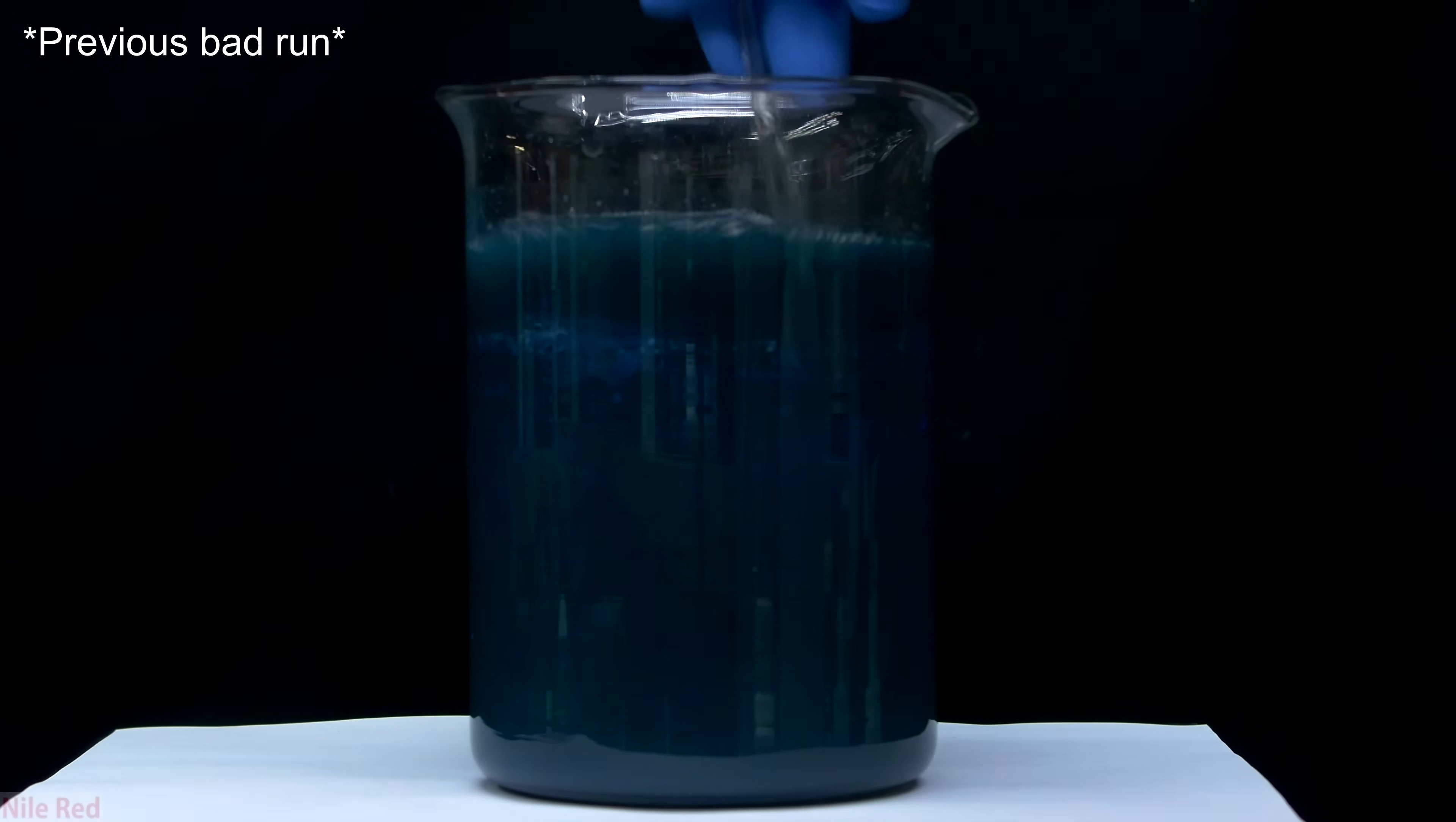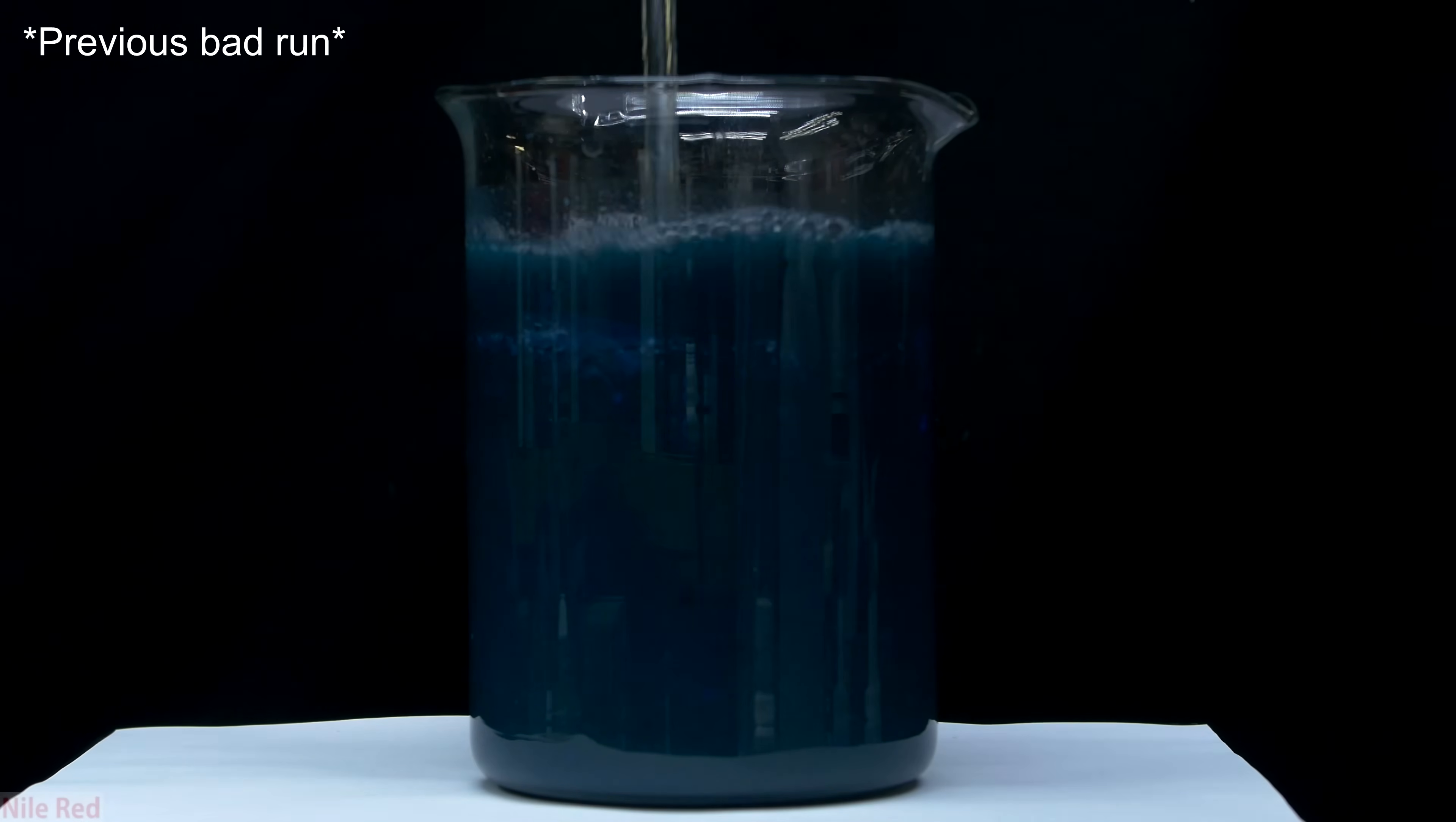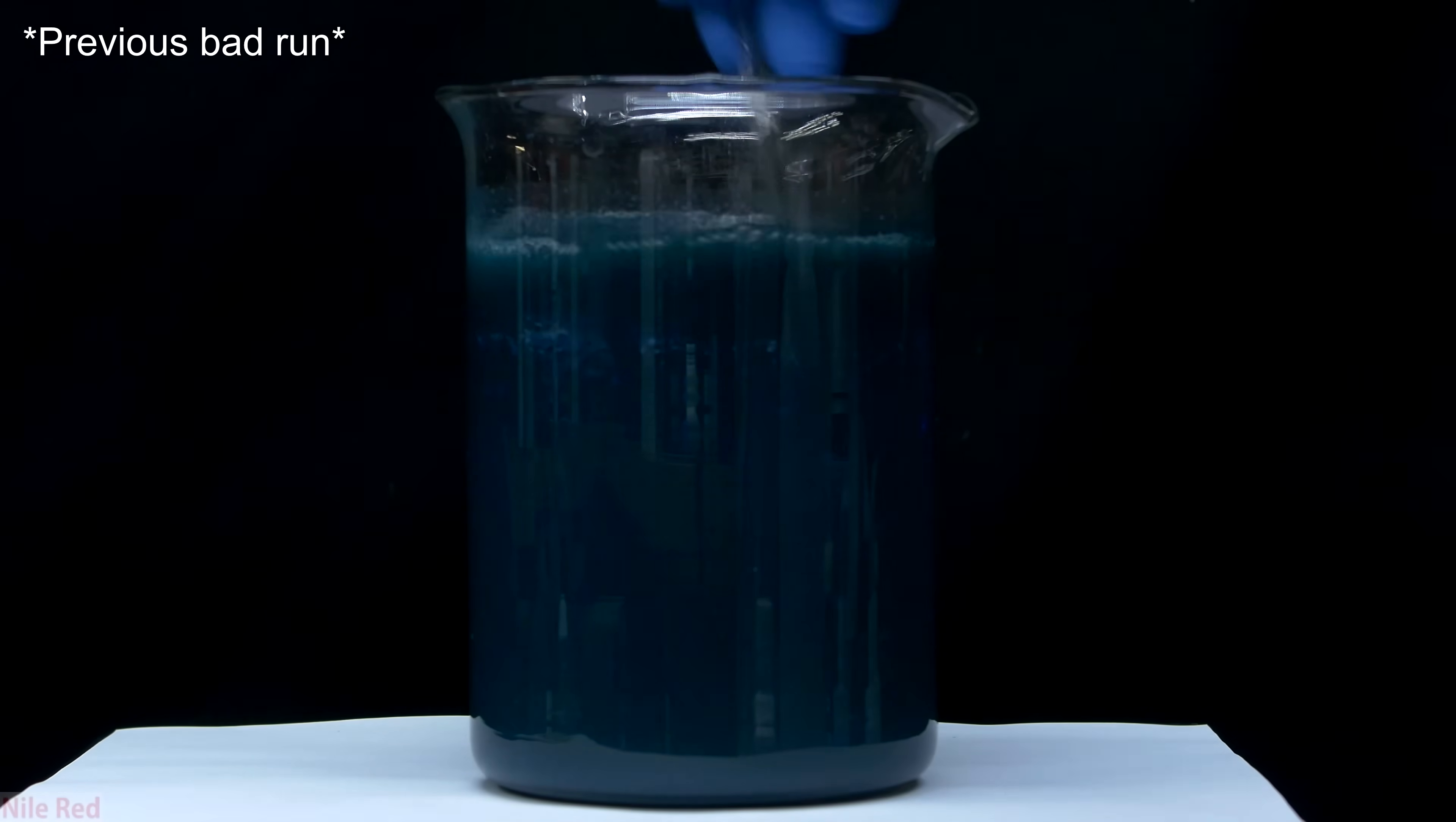So for whatever reason, when sodium hydroxide is used directly on copper sulfate, the product is not very good quality, and it seems to be a little bit unstable.